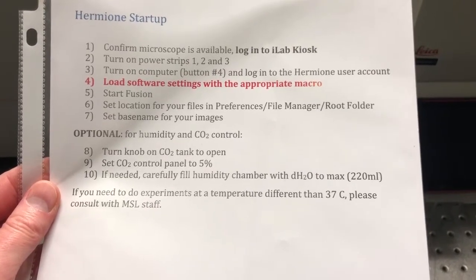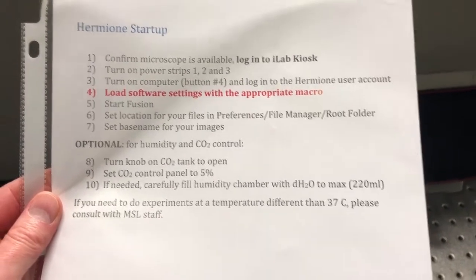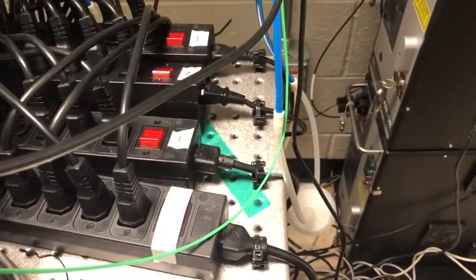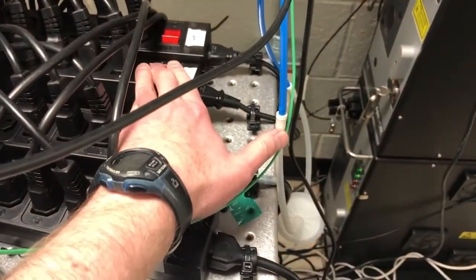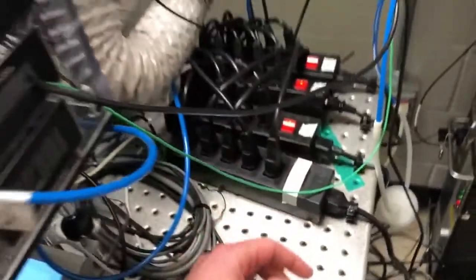The second step is to turn on power strips one, two, and three. Those power strips are back here, so I'm just going to turn them on: one, two, and three. You'll hear a bunch of noises when that happens — those are perfectly normal.